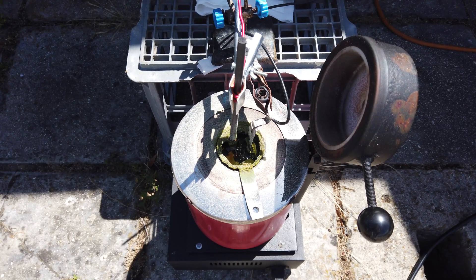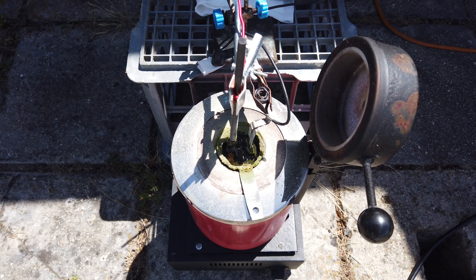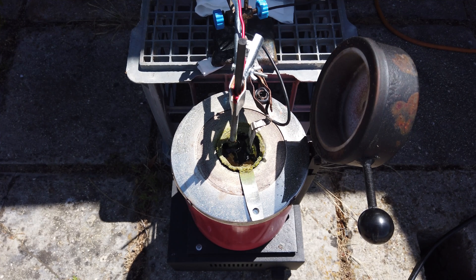About half an hour into electrolysis, running at exactly 8 amps the whole time, the voltage has hovered around 6 volts. We've now finally electrolyzed away, I assume, all of the water that was present in the potassium hydroxide initially — we can tell that because there's a whole lot less bubbling coming off the cathode. Now that the water electrolysis has cooled off, we are actually starting to see bits of potassium form around the cathode — just every now and again some very shiny metal appears on the surface of the potassium hydroxide melt.